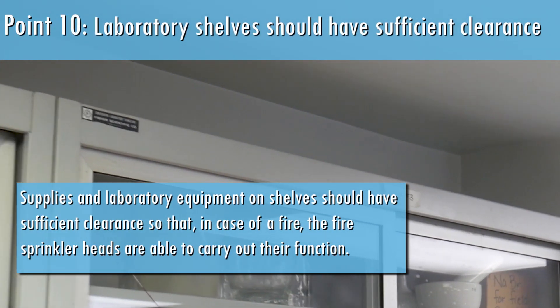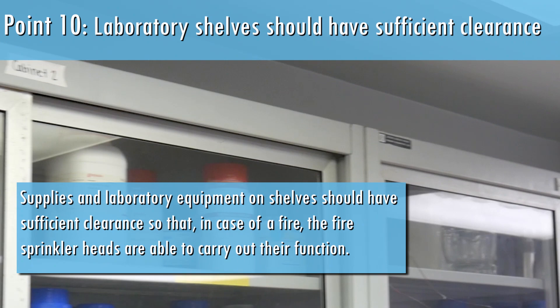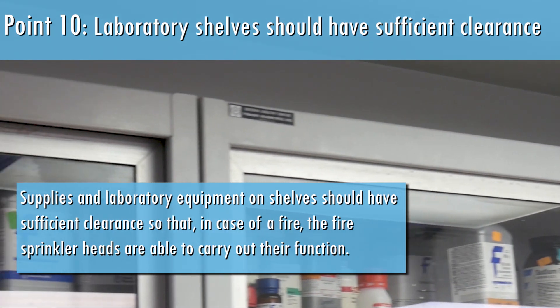Supplies and laboratory equipment on shelves should have sufficient clearance so that in case of a fire, the fire sprinkler heads are able to carry out their function.